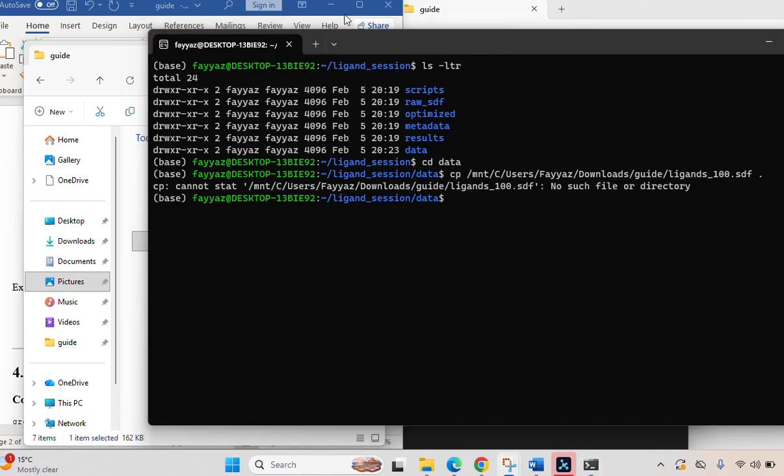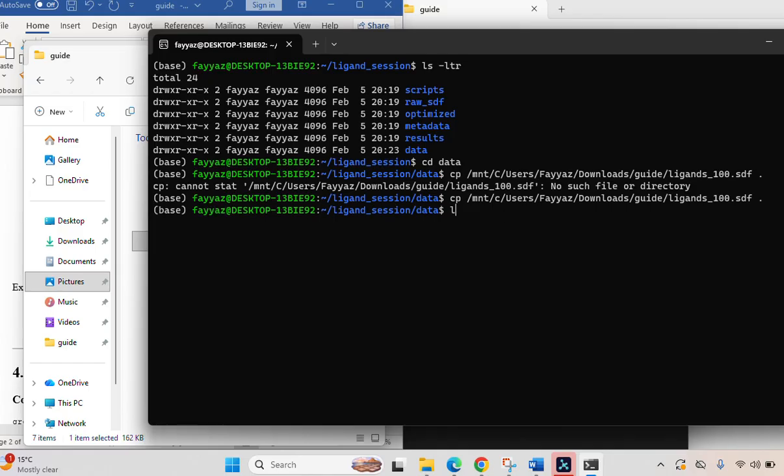So we got an error. The reason is that here, instead of big C, we have to use small c. Let me write it again, and here you can see that instead of big C we have to put small c, and I will press enter. And now let's see if the file is here. The file has been copied. So let's see about the next file.